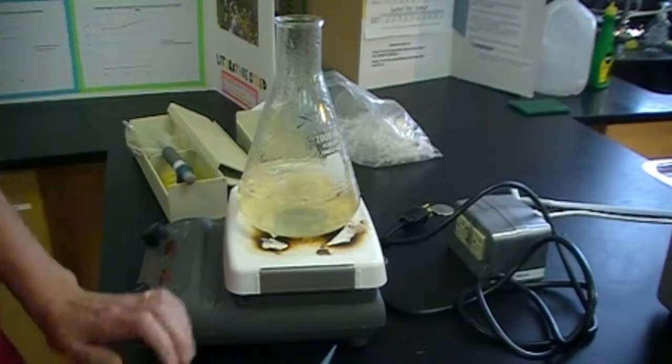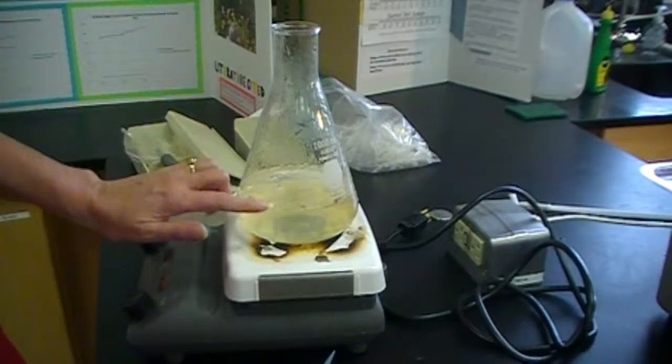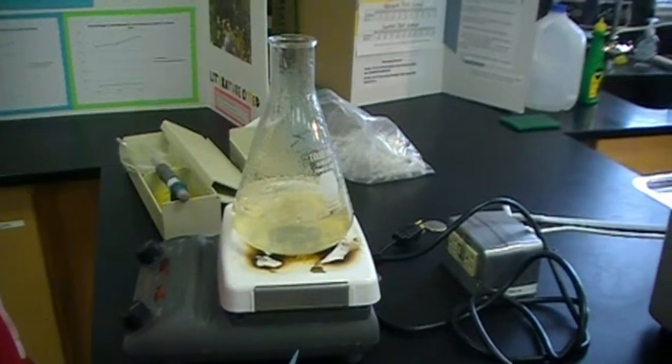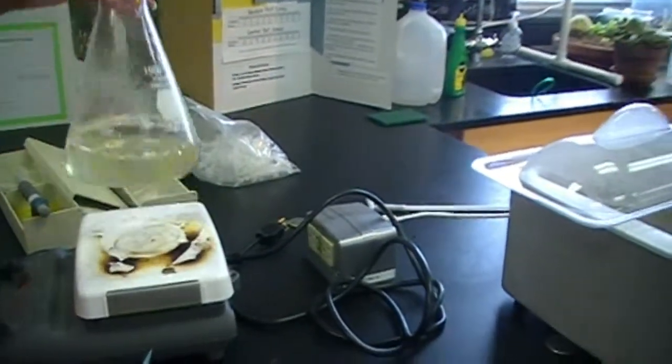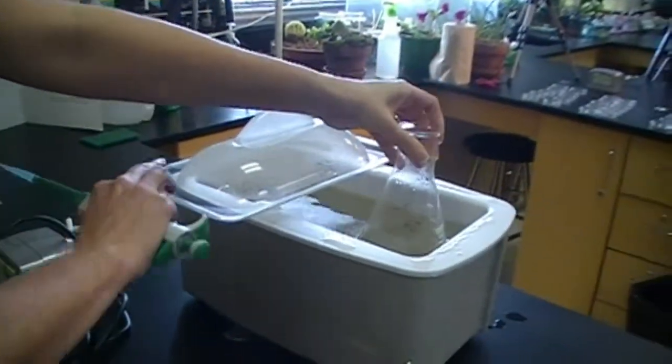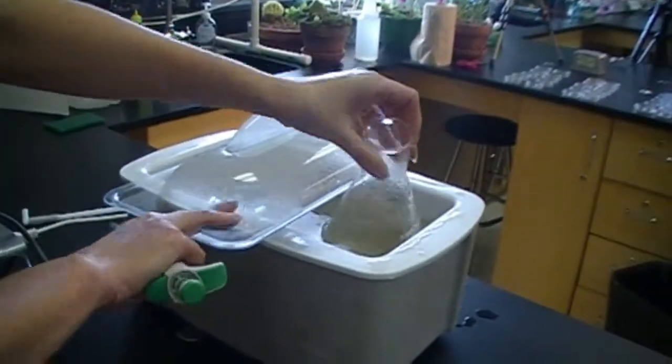After it boils for a couple of minutes, you want to cool down the temperature but still leave it in its liquid state. And so I have prepared a water bath over here at 50 degrees. And I am just going to keep my agar in the water bath at 50 until I am ready to work with it further.